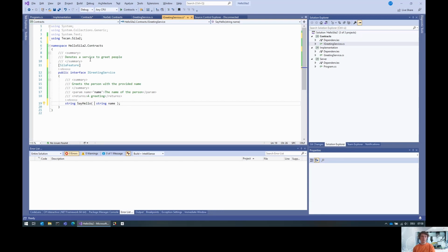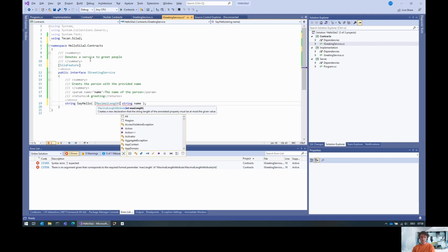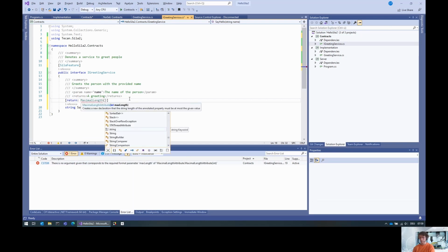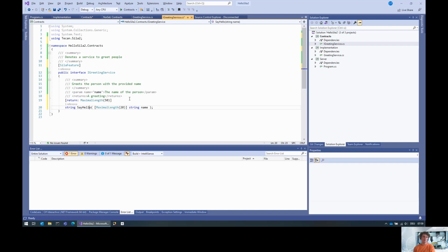What we could actually say is that you can put constraints on certain things, on parameters and return values. We could, for example, say that this name here should have a maximum length of 20 characters. So this is how you use those annotations. There's a couple of annotations for ranges of integers, all the constraints that the SiLA 2 standard provides, also MIME types and units and all this kind of stuff. You apply them all just by applying this attribute to the parameter or to the return value. So I can also put an attribute on the return value. This greeting will be a maximum of 50 characters.